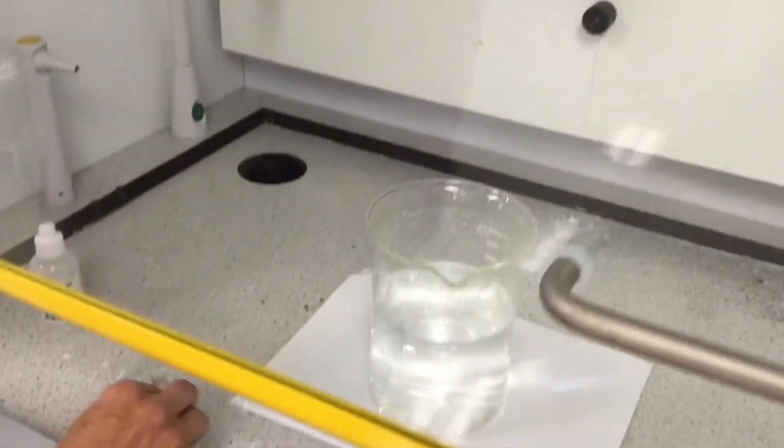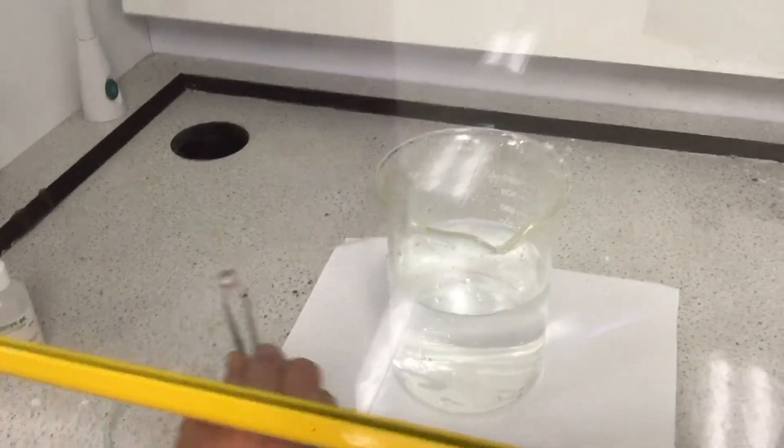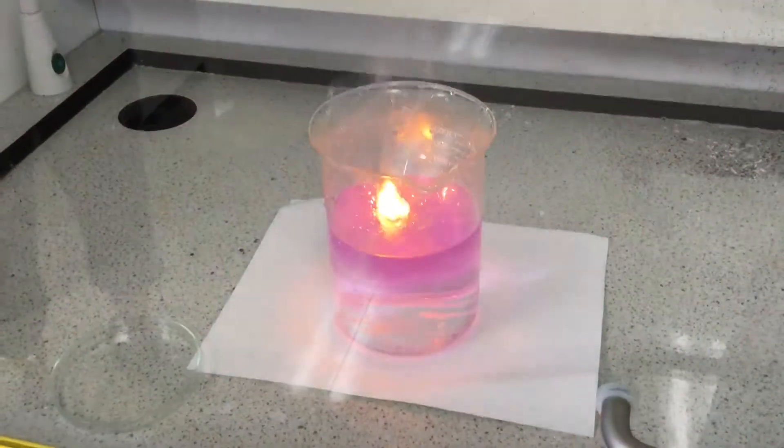Okay, so I'm going to prep for this one a little. And we're going to take our sodium chunk and just drop it in here. You ready? Go for it. Bam. There she goes. Wow, look out! Oh, nice.